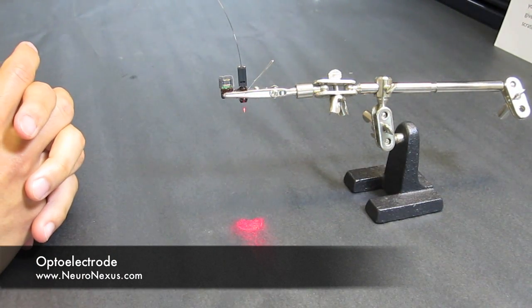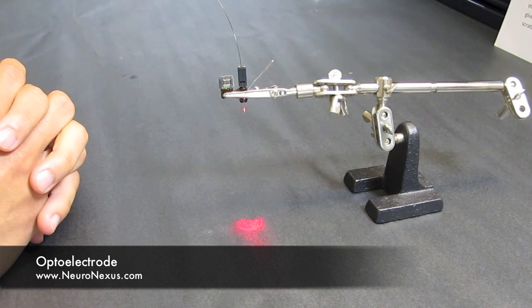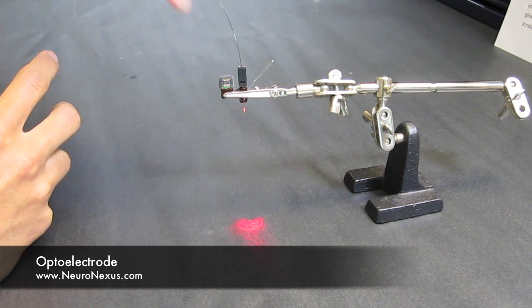The chronic coupler was designed to be small, light and easy to use. It even has a low friction swivel on the back to keep strain off the animal's head.